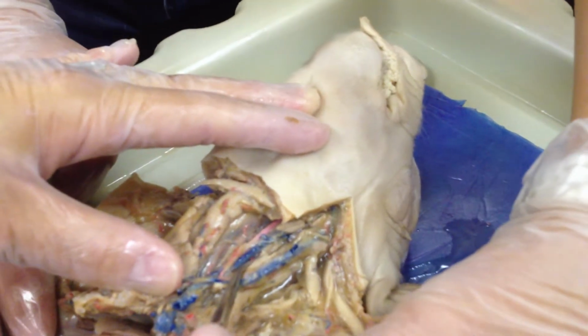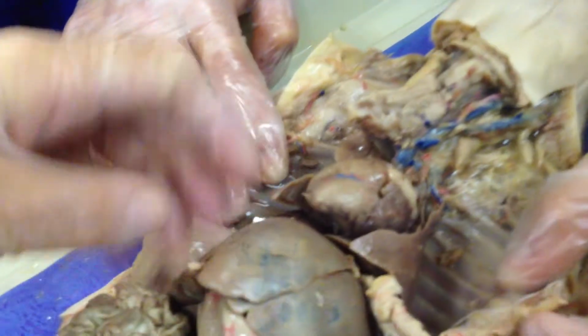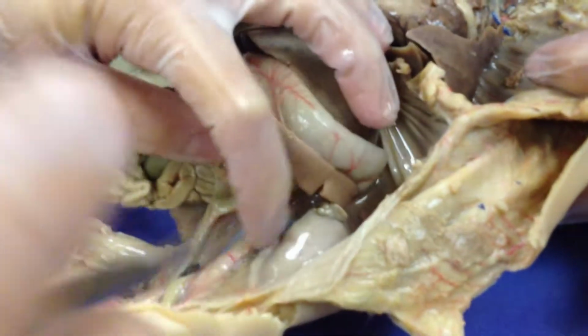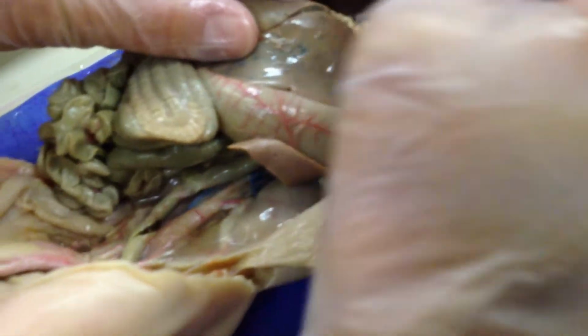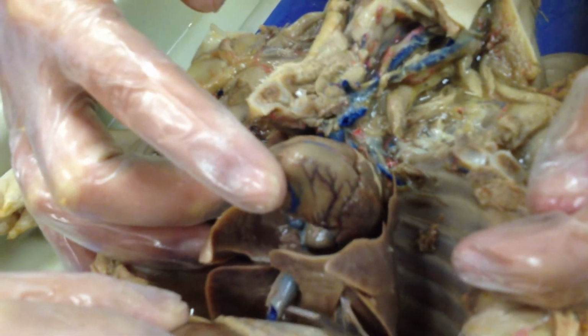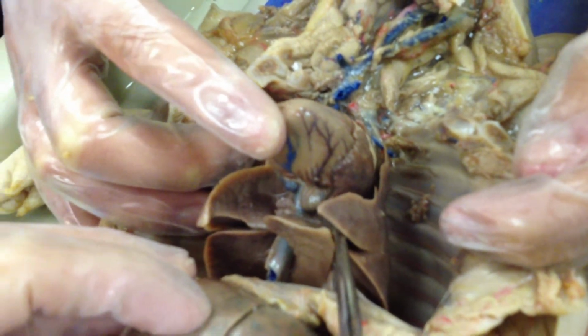Inferior, caudal vena cava. Okay, so when you go down here and you kind of push, which side do we push this aside on? This one. Right here. So way down here is the easiest place to see the vena cava, the inferior vena cava, and you can also see right here under the heart and in the middle of the lungs. You can see a little bit of it. And again, I nicked it. These really thick blood vessels, it's kind of hard to see what's inside before you nick it.